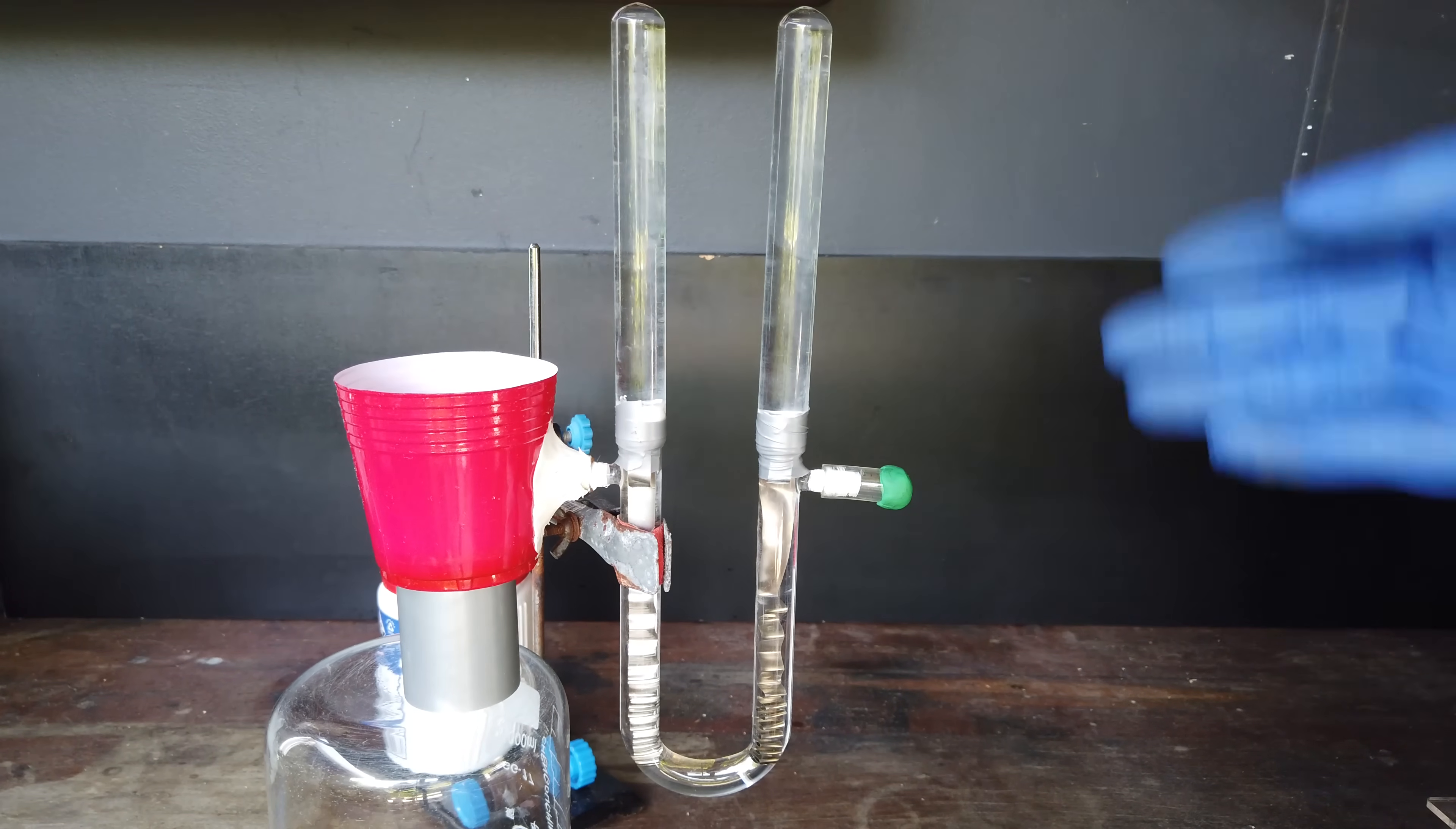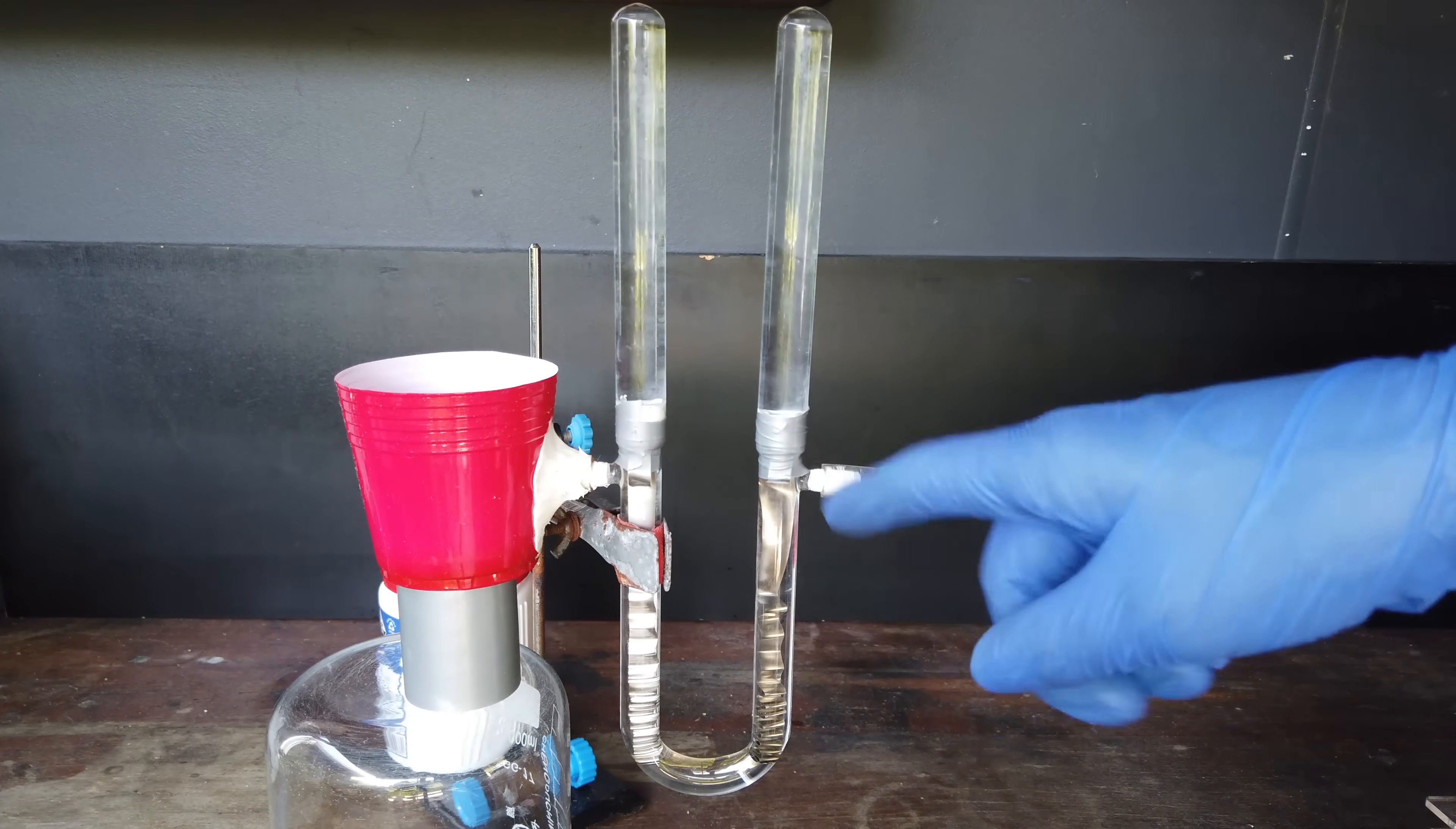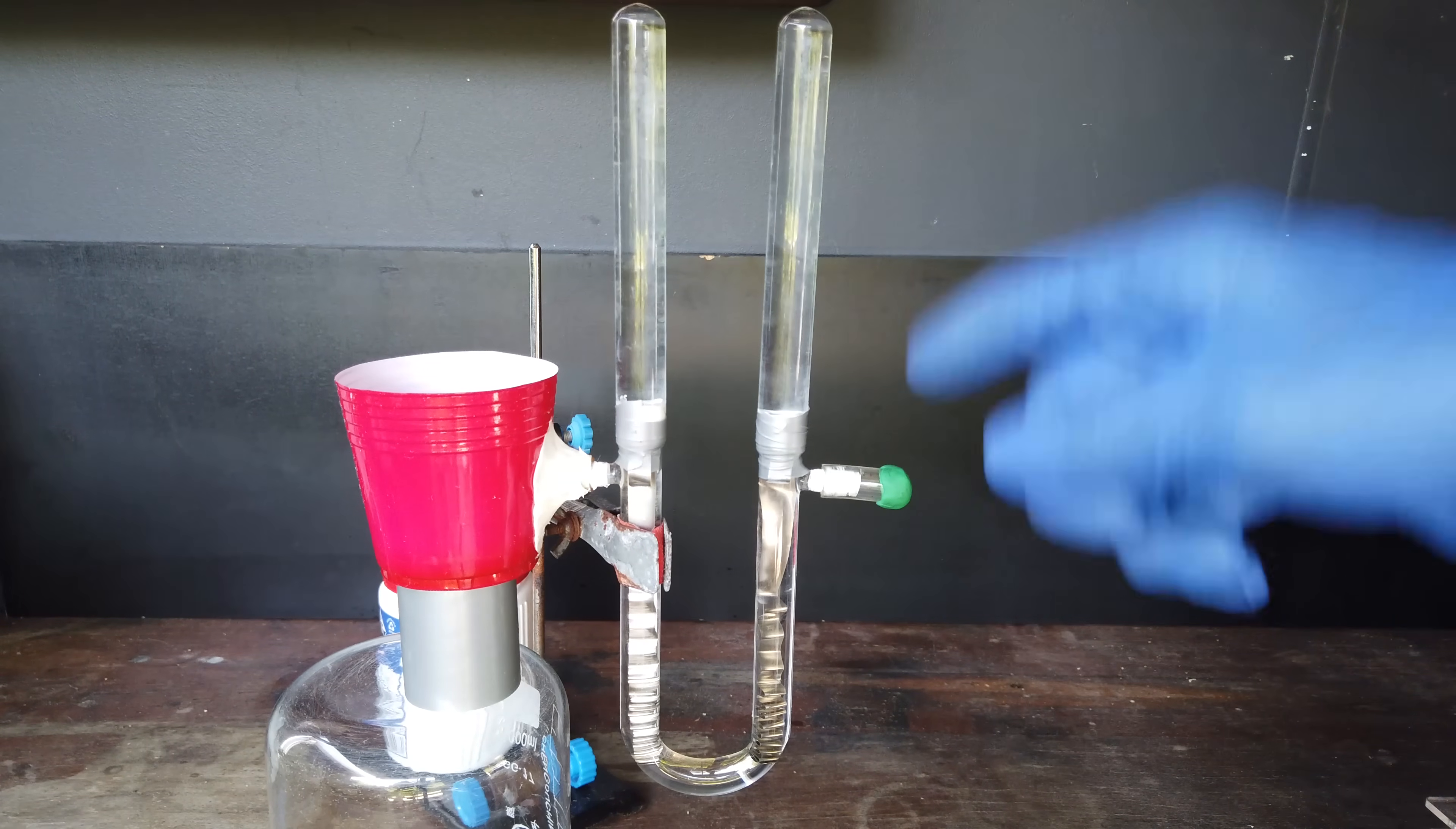You can see what I've done. I painstakingly added our sodium hydroxide and urea solution to this vessel, and I was able to get rid of all of the air in here. So these two test tubes that I've stuck to the top of our U-tube, these are completely filled with solution. There's no gas in them. In fact, there's no gas in this whole apparatus whatsoever.